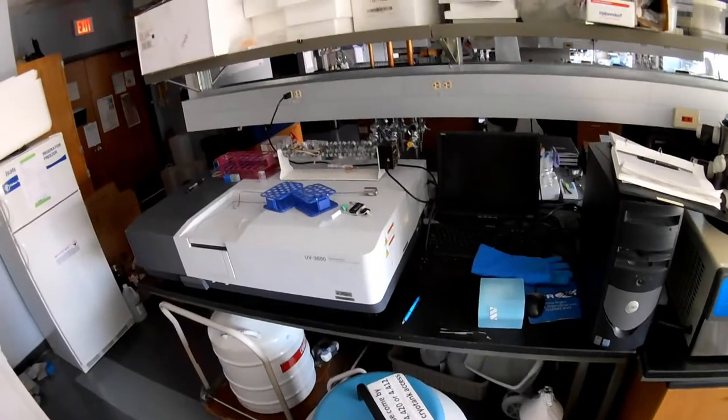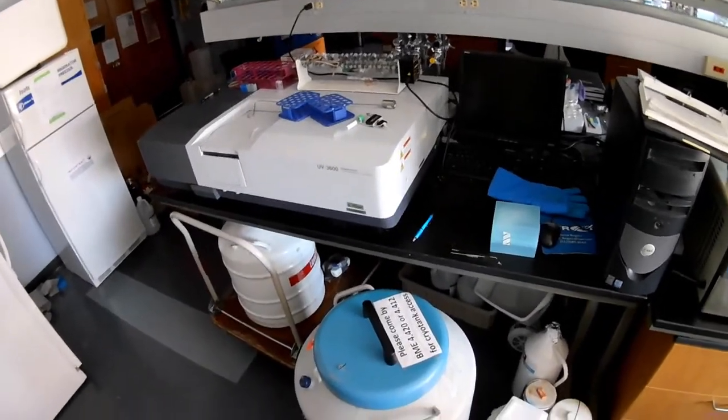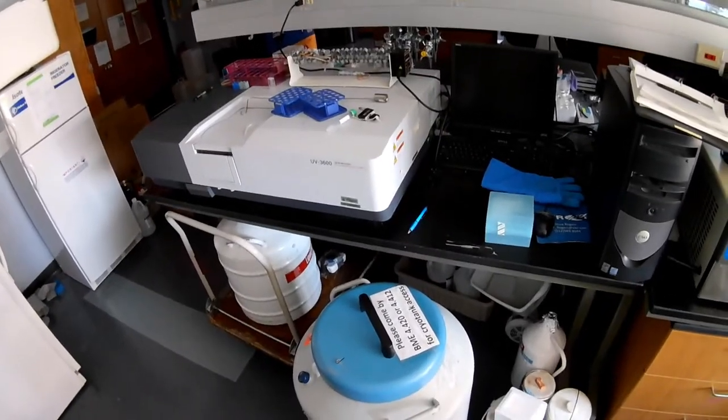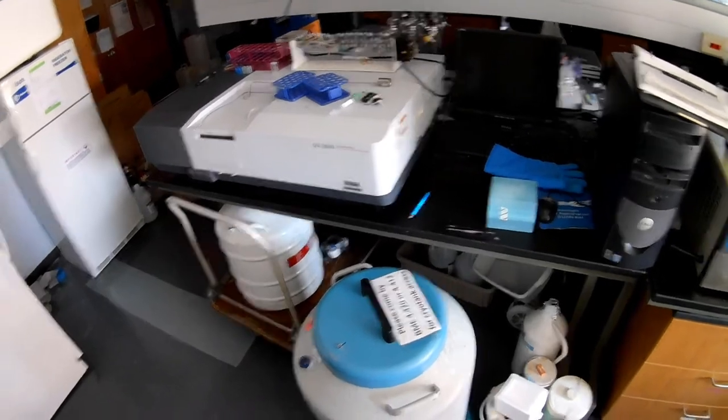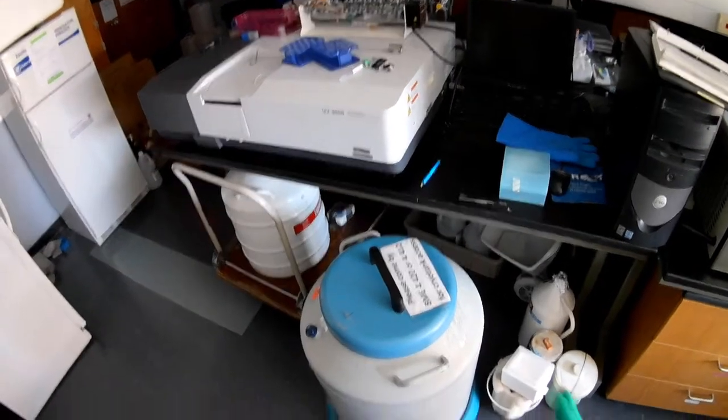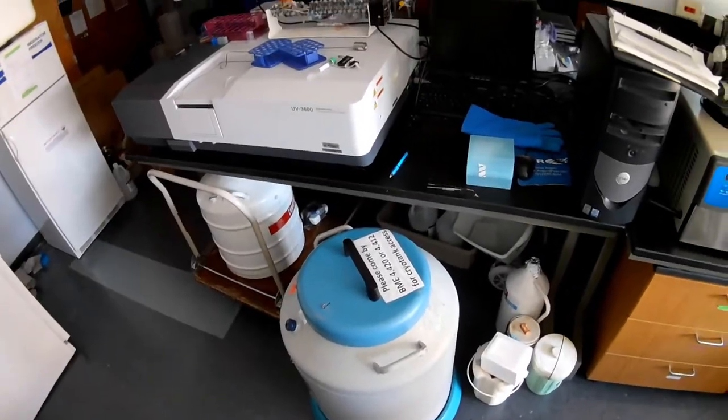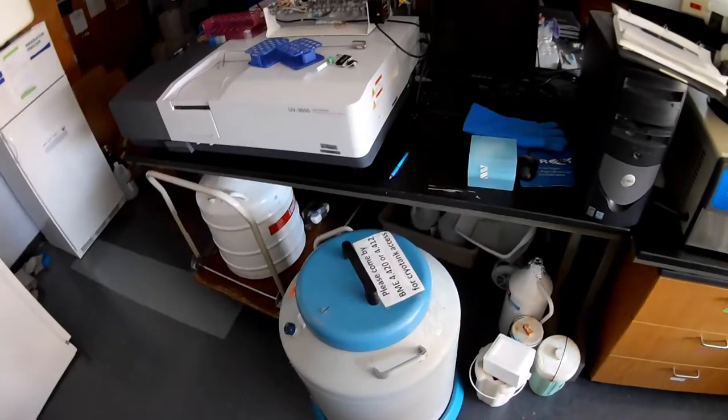The first thing we want to think about is where we can store cells. Normally cells are stored long term in liquid nitrogen. They could be that way for many years. And so here's a small liquid nitrogen flask that contains a bunch of cells.